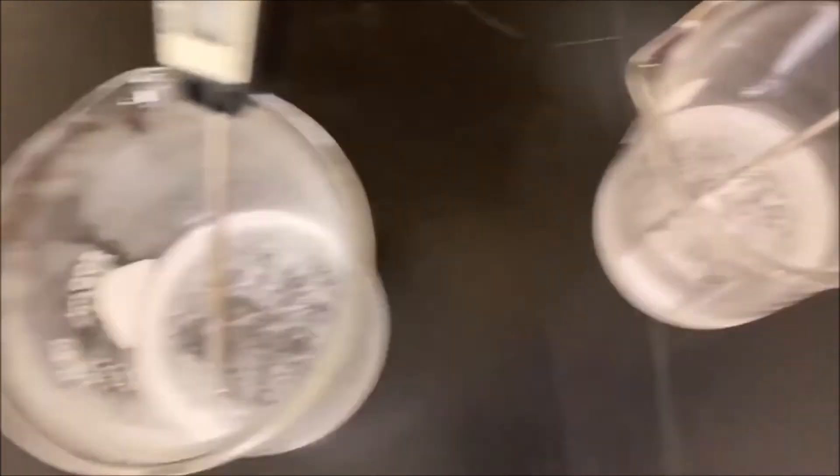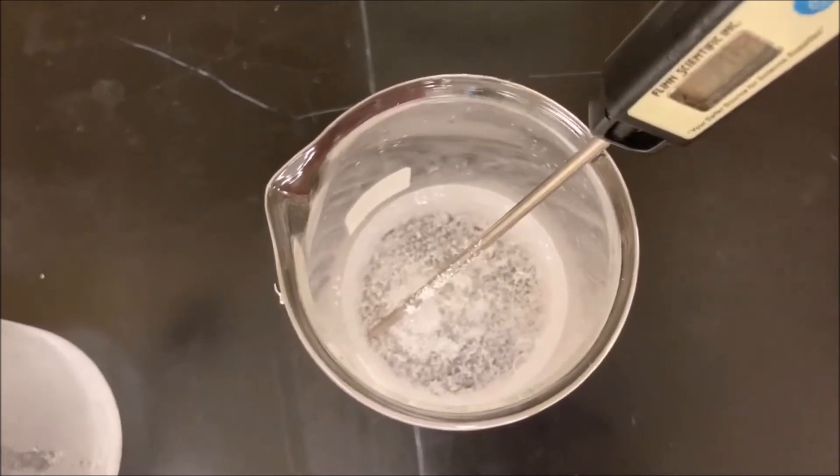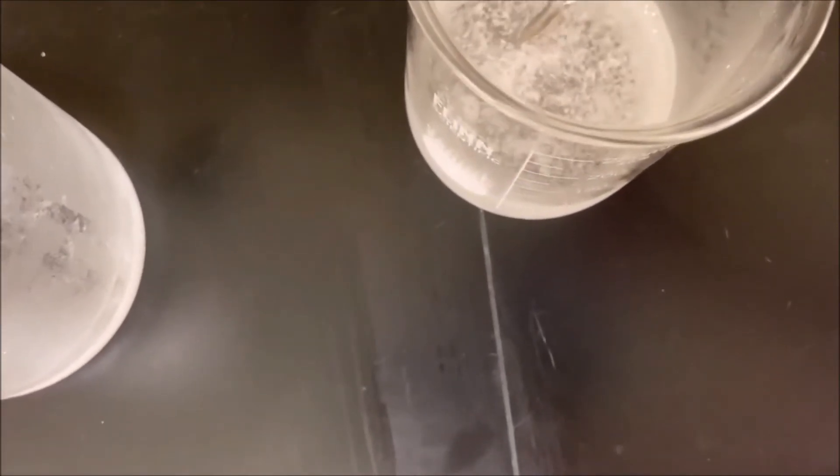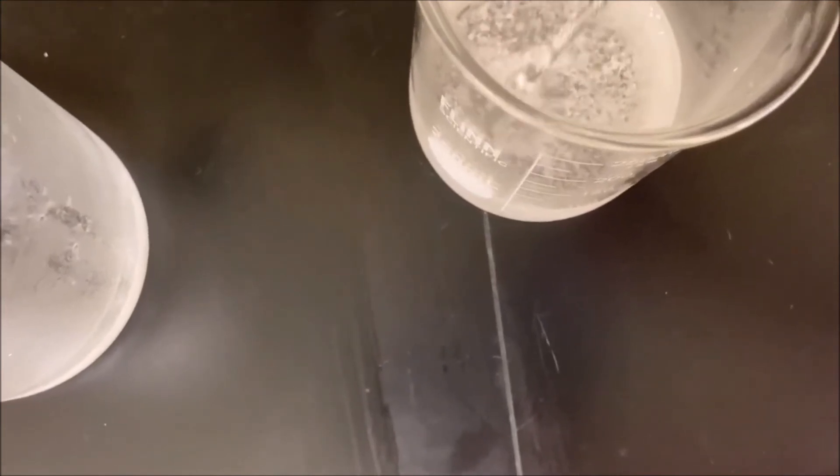Over here we have our one that's heating up and we can actually see a little bit of reaction starting to happen. A little bit of bubbling but not much.